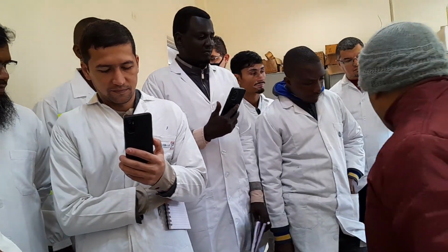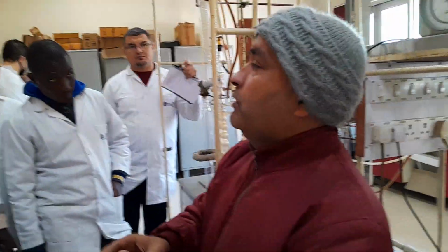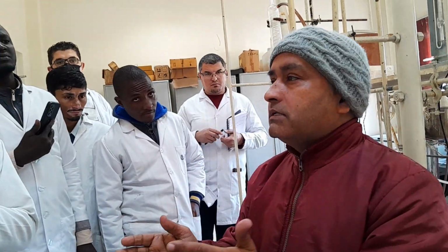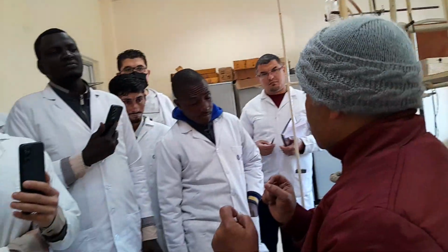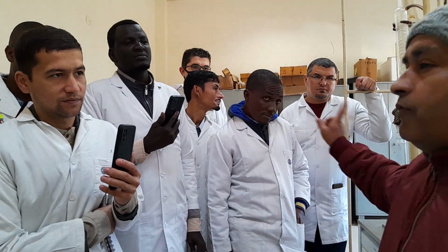Now, after dehydration, the LPG potential has been collected. Now TBP distillation. As I told you, initially you will check the IBP. IBP means initial boiling point. Sometimes it is asked in the interview: what do you mean by IBP, and what is the difference between IBP by fractional distillation and IBP by ASTM D86? This is a very, very important question asked in interviews. Can somebody explain the difference between the IBP we get from D86 and the IBP we get from fractional distillation?